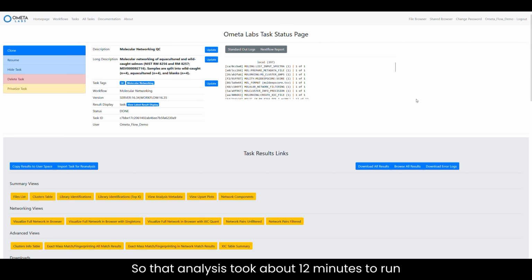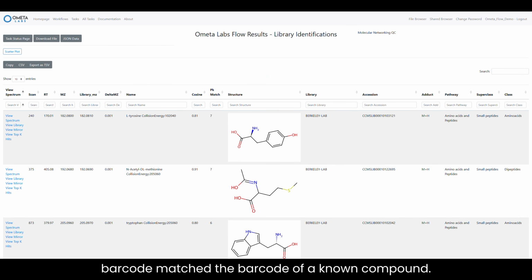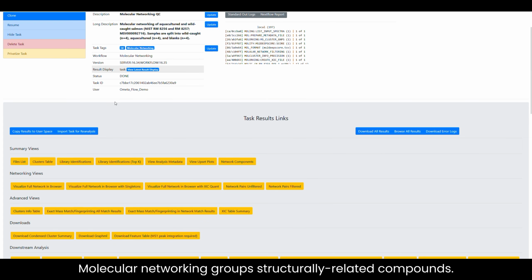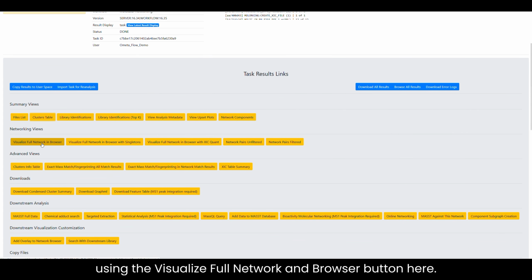So that analysis took about 12 minutes to run and identified over 3,000 metabolites in these samples. About 600 of those have library annotations, which means that the MS2 barcode matched to the barcode of a known compound. However, we do have a way to glean information about all those unknown molecules using molecular networking. Molecular networking groups structure-related compounds. You can open up the molecular network using the Visualize Full Network in Browser button here.